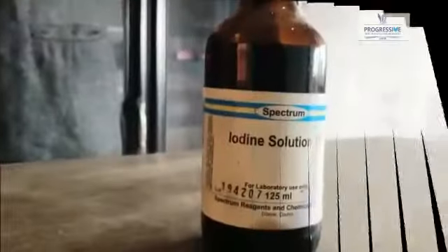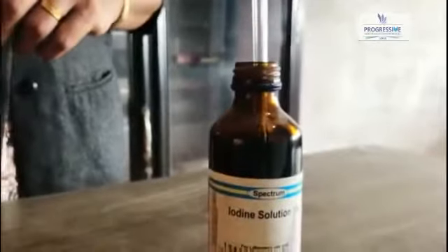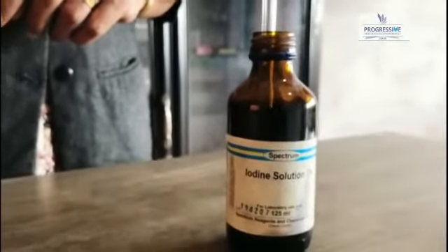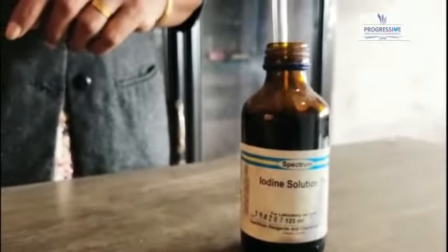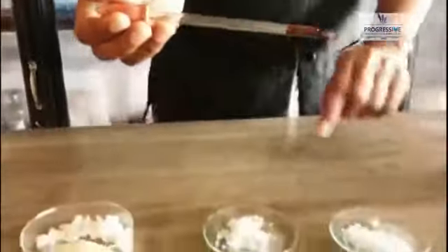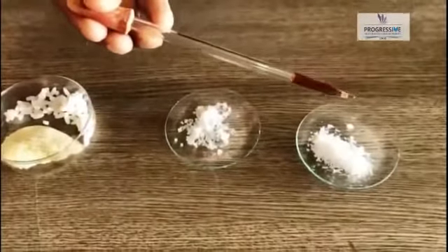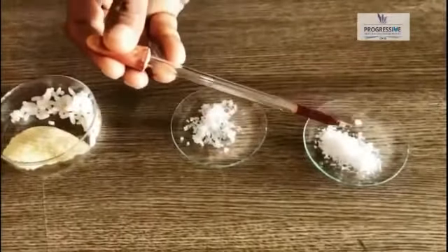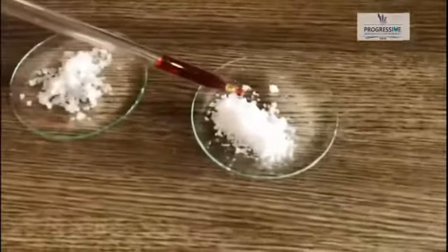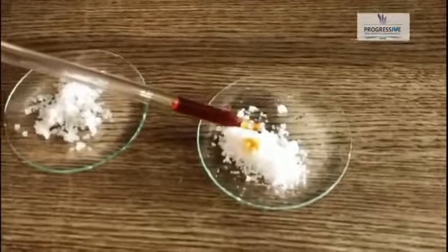So we can observe. First we want two drops of iodine solution. I am taking this iodine solution by a dropper. Now I have some salt here and I am going to add two drops of iodine solution on this salt.